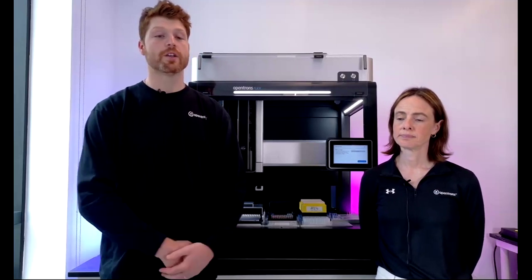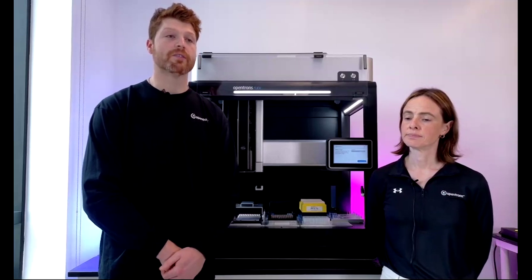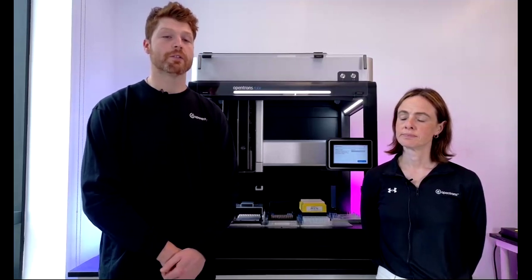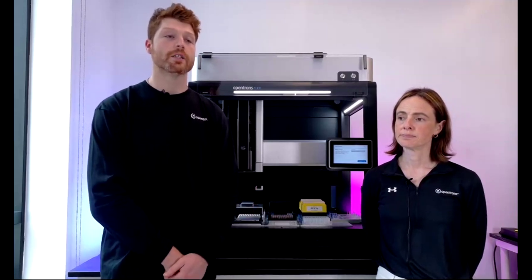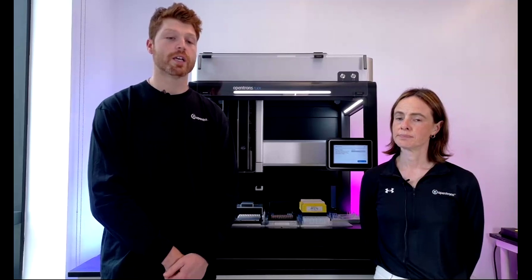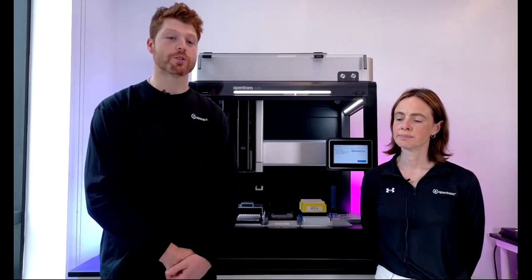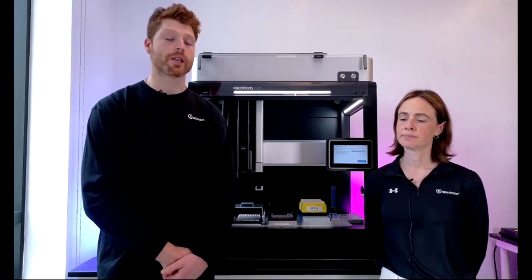And then another really good option is the on-site or remote protocol development by FAS, so that you have robust, well thought out starting points if you wanted to continue to tweak, or hopefully just a protocol to run with immediately that is exactly what your lab space needs.